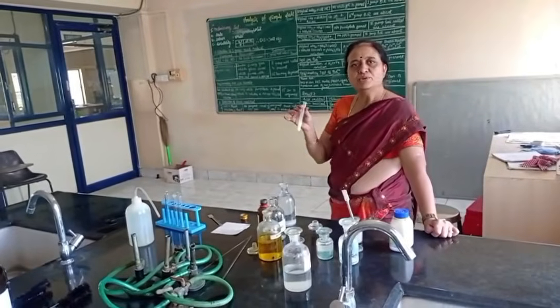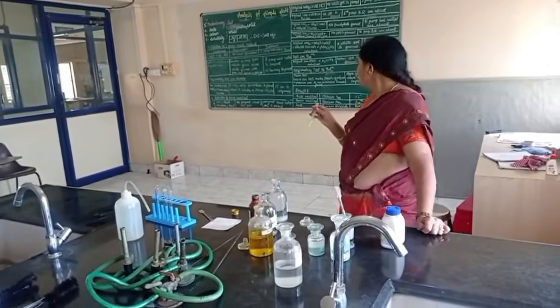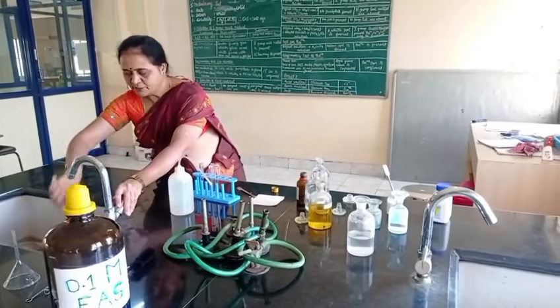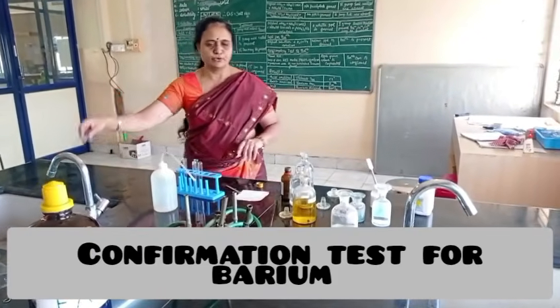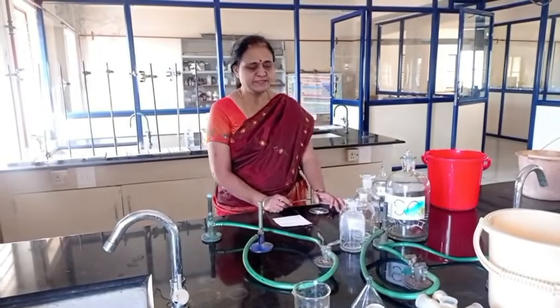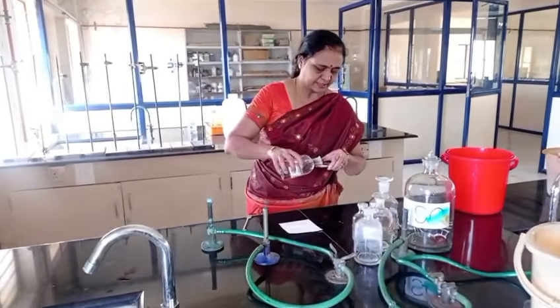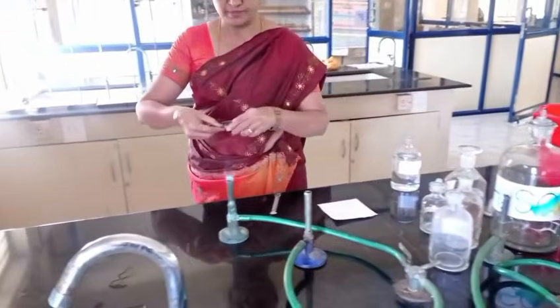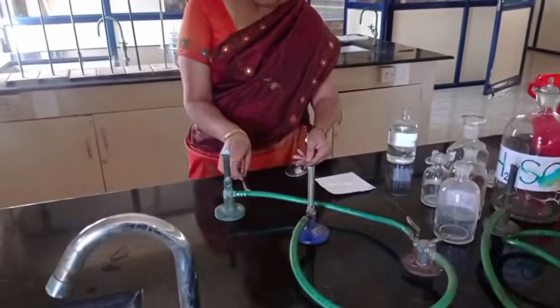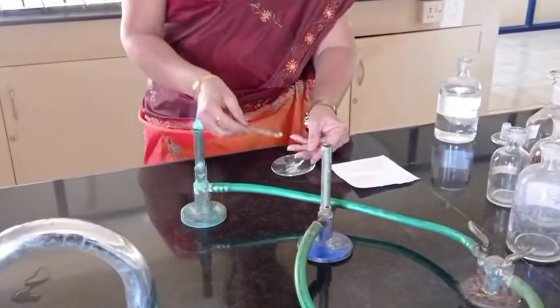Now, I will do confirmative test for barium ion, Ba2+ ion, that is flame test. Flame test is the confirmative test for Ba2+ ion. Make a paste of the salt with concentrated HCl and ignite the paste using Bunsen burner.